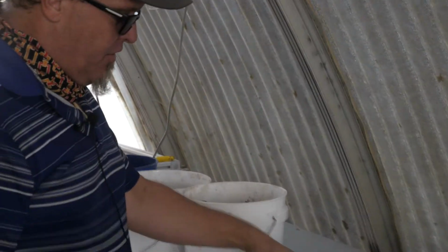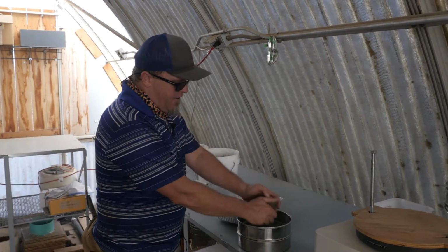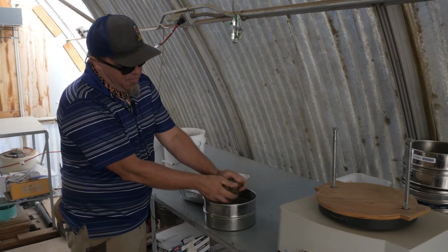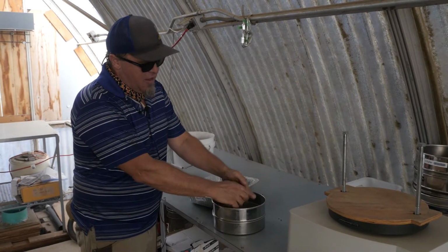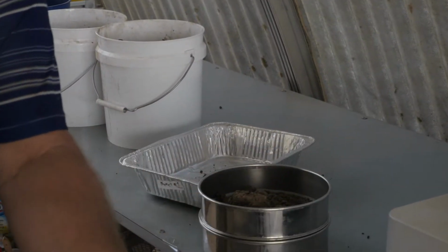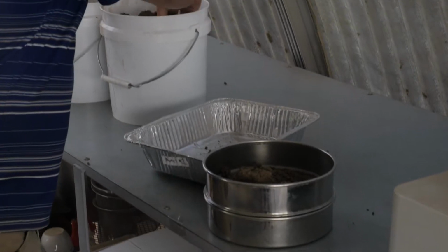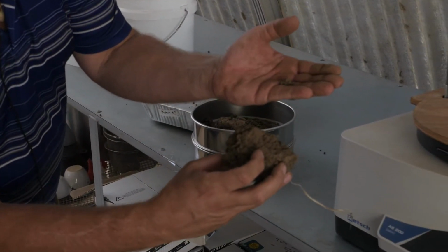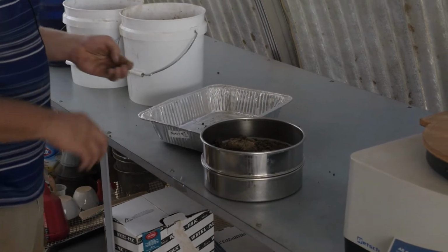We're going to take this sample, put it in the sieve, and kind of crush it up to start. See how easy that crushes when I break it between my hands? It really just wants to come out. But then you get these substructures which look like the original, right? This little piece looks not too different in shape to this bigger one. And that's kind of a symbol of what aggregation really is.